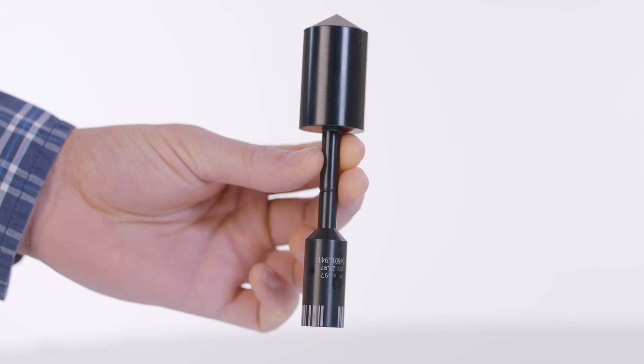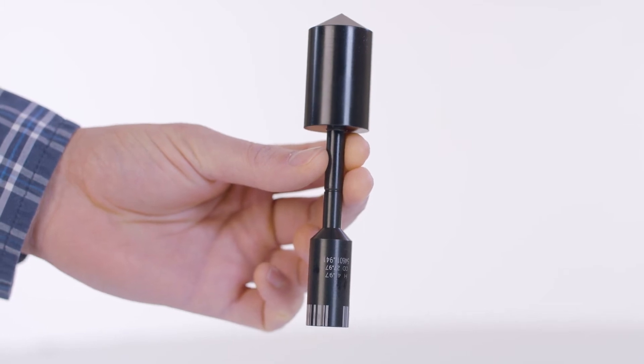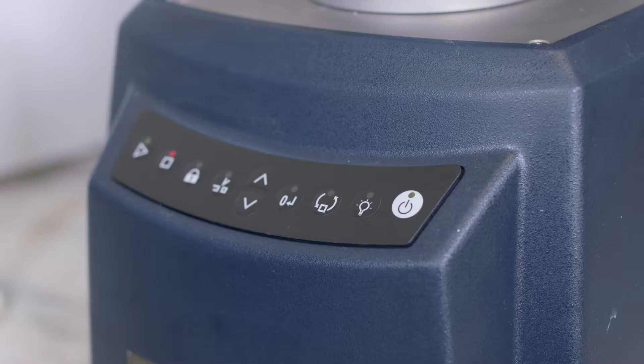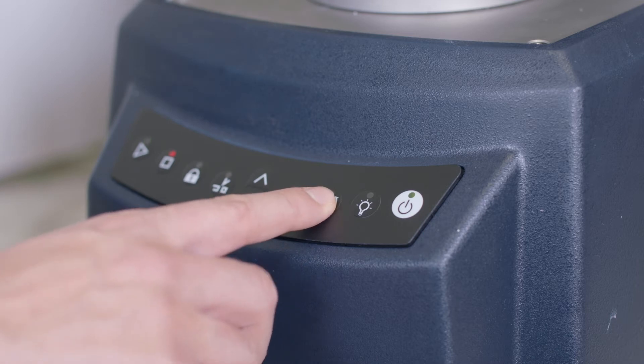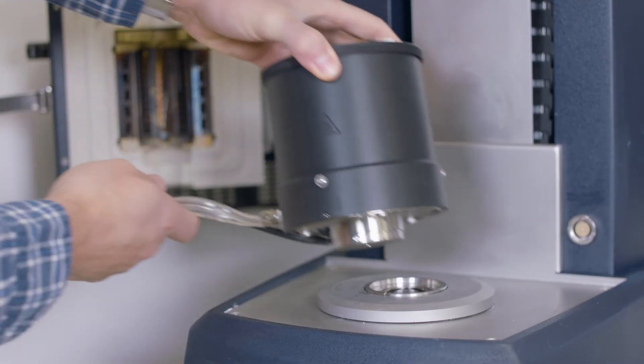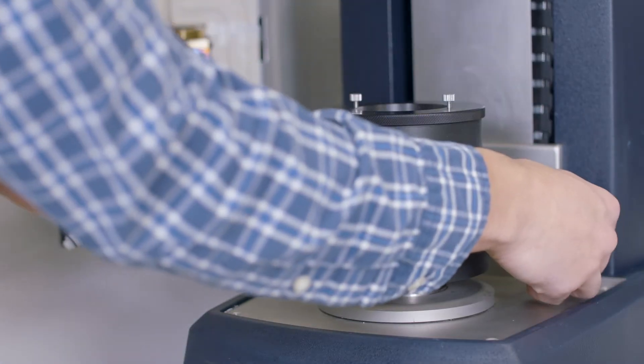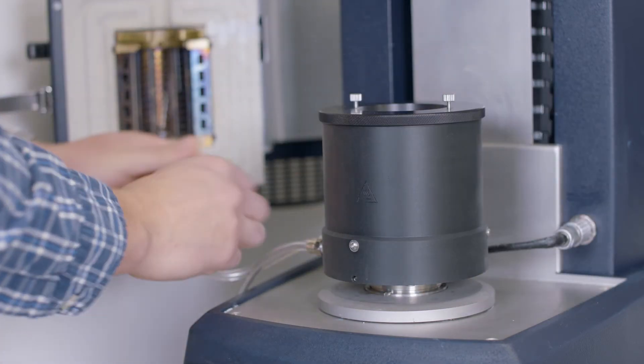Here I have a DIN rotor which works for a wide variety of samples. To start, we will disengage the base magnet to install the Peltier jacket, the cooling lines, and the smart swap cable.